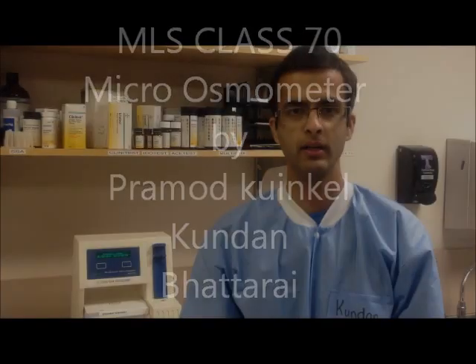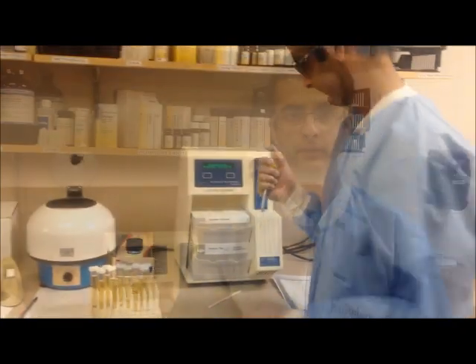Hello. Today we are going to demonstrate how to use an advanced micro-osmometer to measure the osmolality of a given solution.